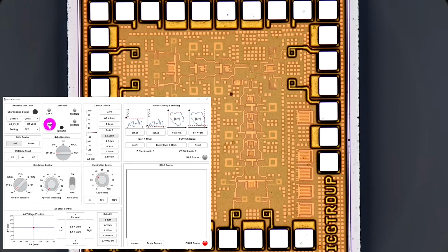Now the software automatically calculates the depth of field of the lens that's selected. We have a 10x lens selected here, and you can see it's calculated the depth of field of that lens to be 10 micrometer, and the field of view to be 2.35 millimeter, which makes sense. This means that anything that is taller than 10 micron is not going to be in focus in this configuration that I have with the lens that I have.